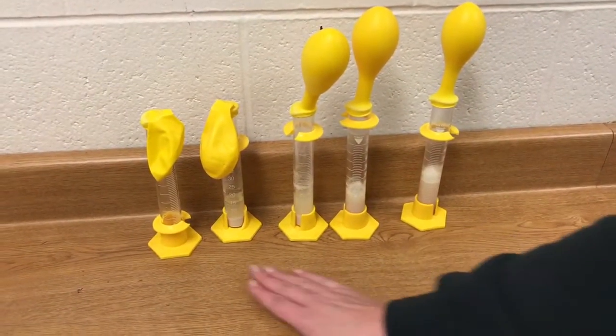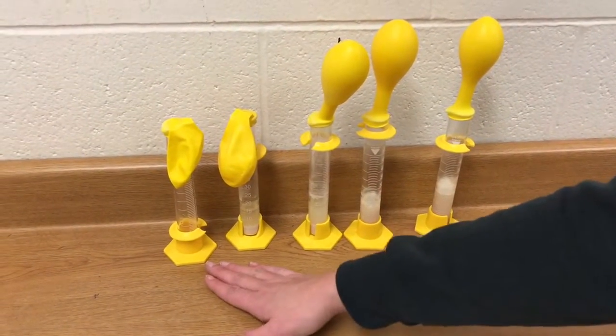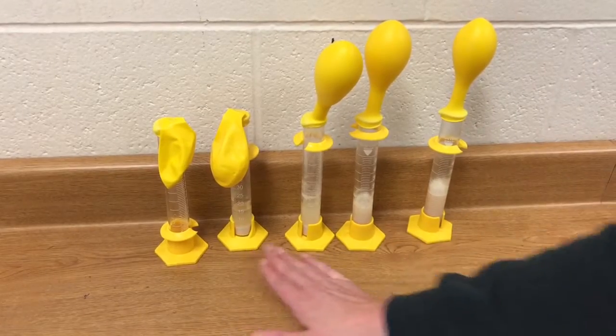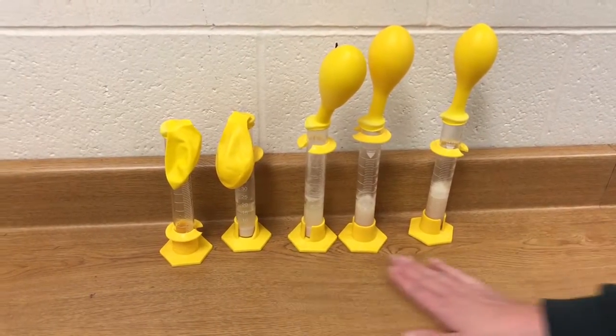Keeping in mind that right here this first one was our control, it did not have sugar, and then these four cylinders had different amounts of sugar.